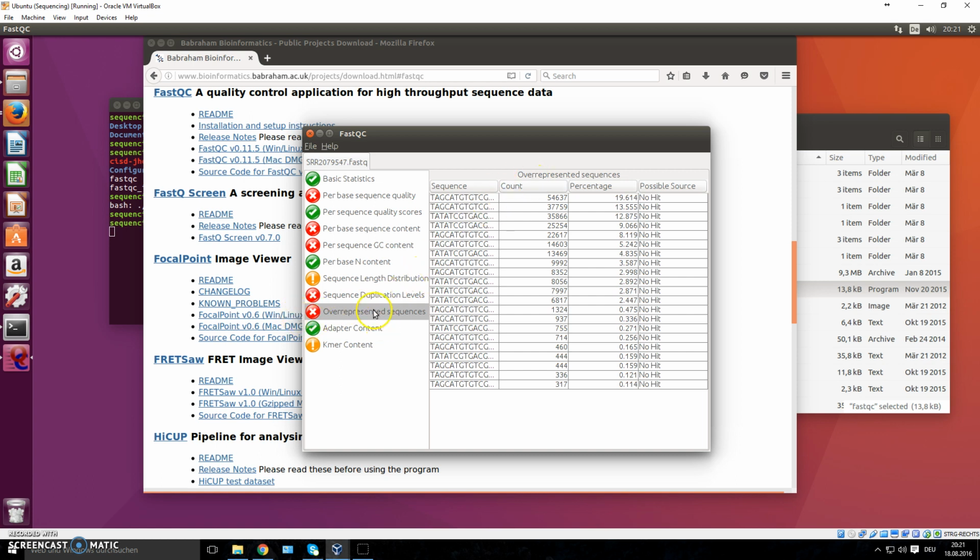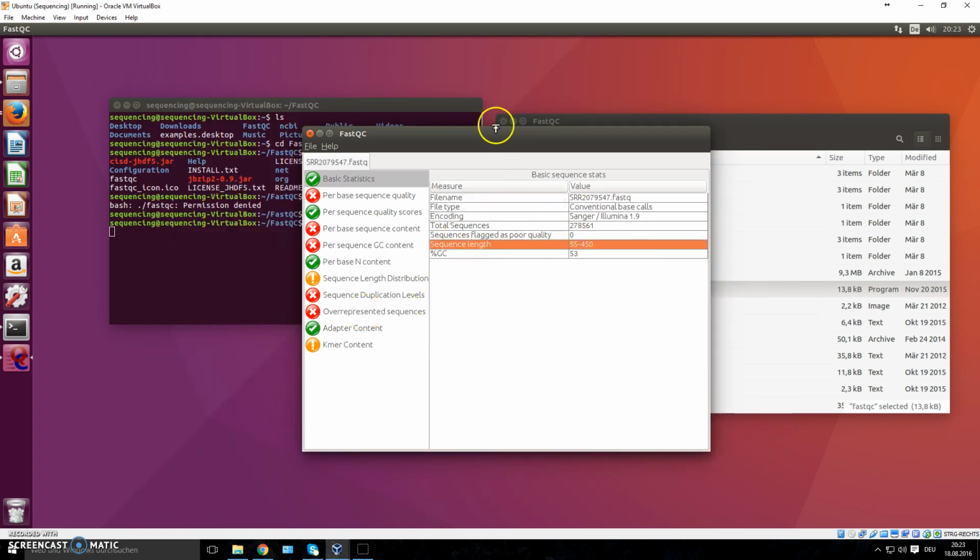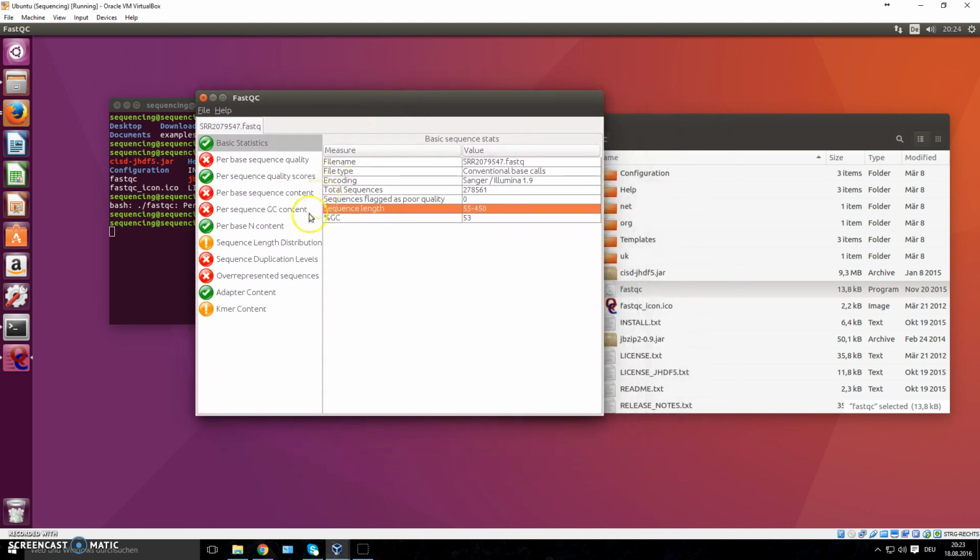So just because you get an X here doesn't mean that you can't use this data. You have to obviously interpret it. And something else worth mentioning is that you can also run this FastQC analysis without this graphical user interface. And that's important for pipeline coding. So for you to write a script, a program that does a lot of different tasks one right after another for a lot of files, let's say 100 files, and finishes all of these things in like 10 seconds. It does it for many, many sequences, many reads, gives you the quality scores, and does a lot more. So that's important, to run these things without a graphical user interface.